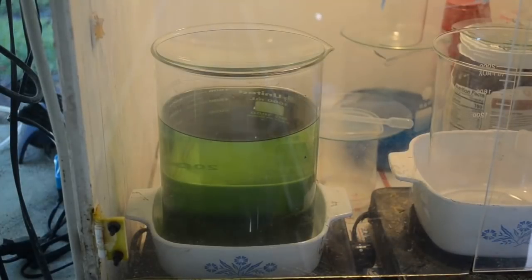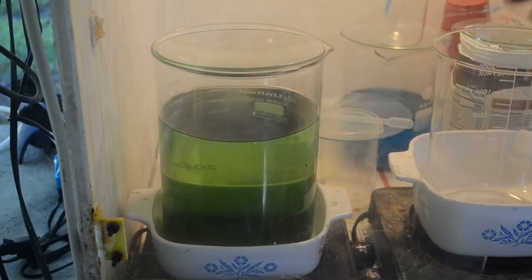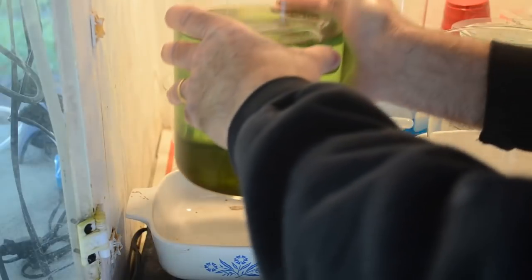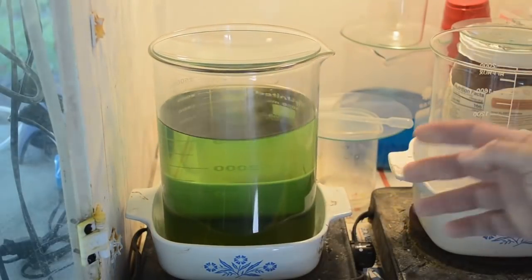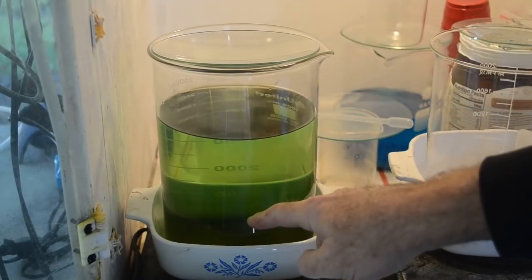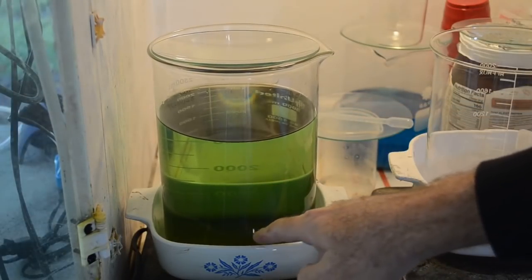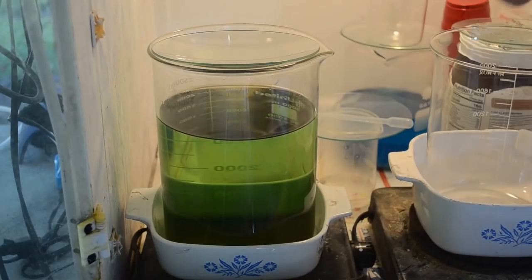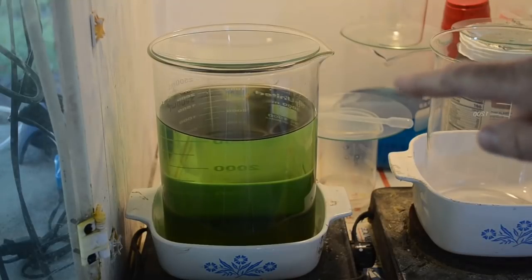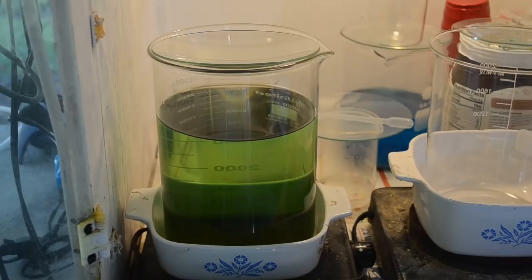Well, it's the next morning. We've still got some lime green Kool-Aid in here, but with a nice layer of gold on the bottom. So I will get started retrieving that. What I will do is siphon the liquid off just like I did before, and then transfer the gold on the bottom of this beaker into the other beaker that has the gold from the first half of this batch. And then I will redissolve that all in aqua regia, refilter it, and redrop it, and hopefully get some nice clean gold without all of the silver chloride in it.